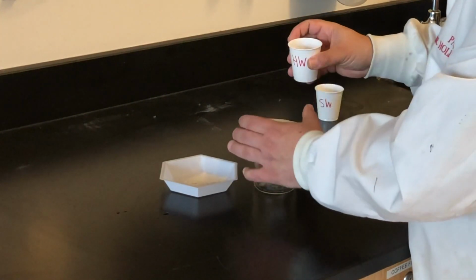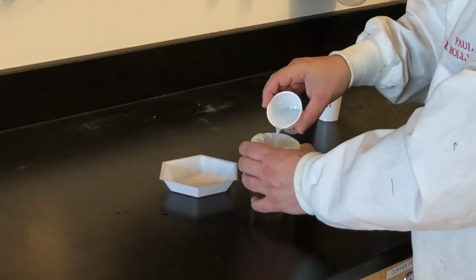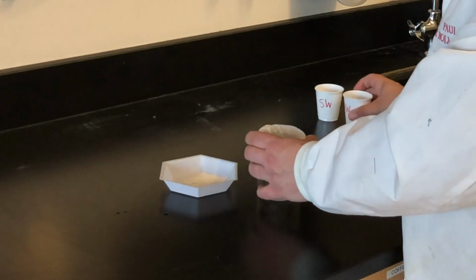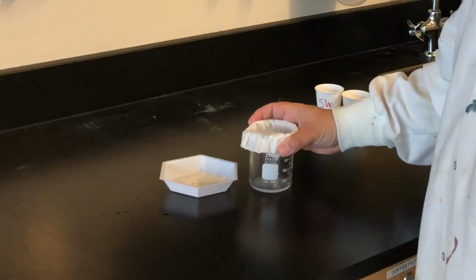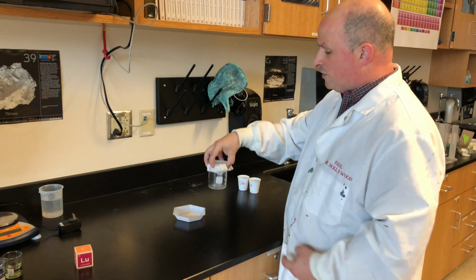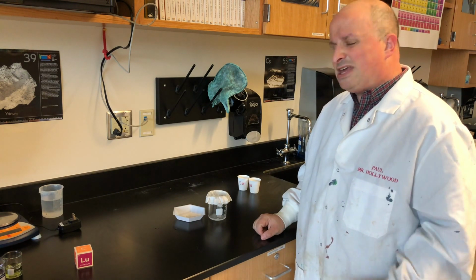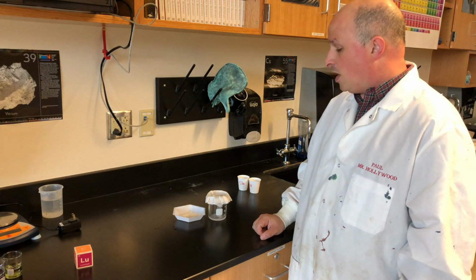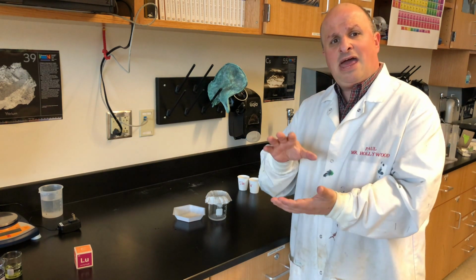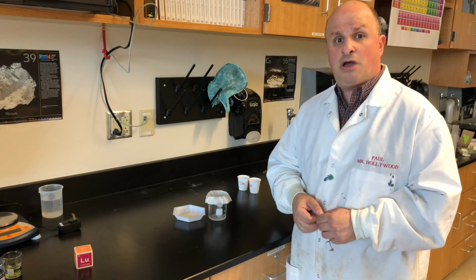But now, with one hand holding the coffee filter in place, we're going to pour this liquid into the coffee filter, careful not to let it overflow, and not to let the filter fall down. And we're going to let it sit here. You'll see the water dripping through the filter. We want as much of that water as possible to drip through, so we're going to give it a couple minutes to let that happen. When we're done, we're going to have a coffee filter that's a little bit damp that has some milky white stuff on it. Some of that milky white stuff is soap scum.